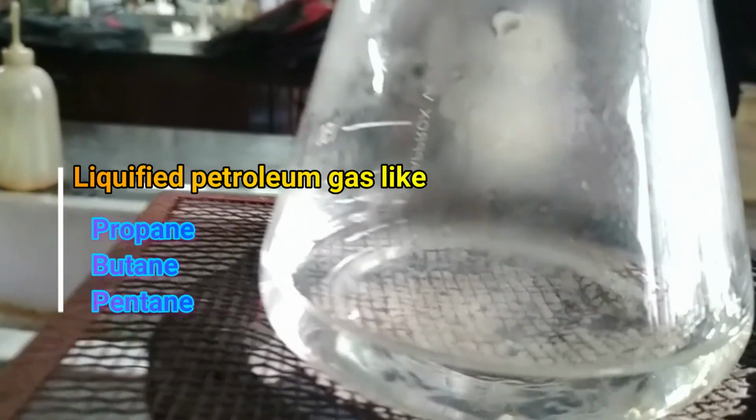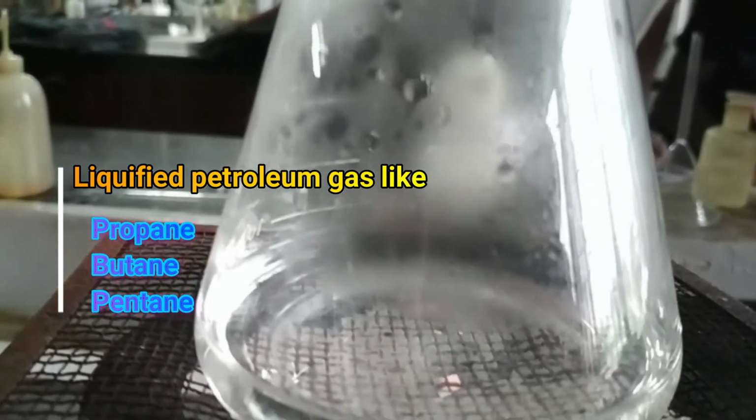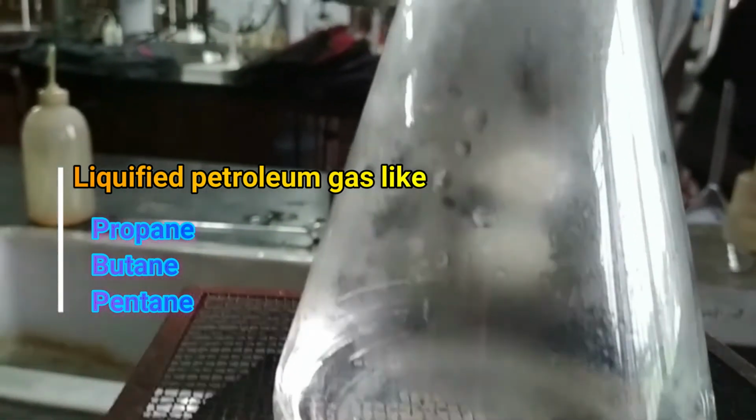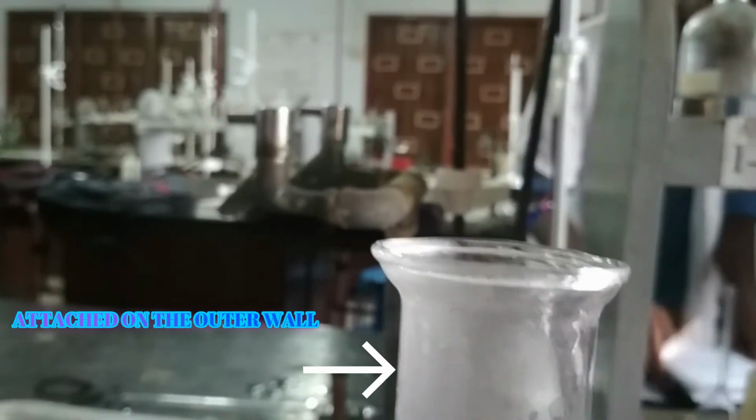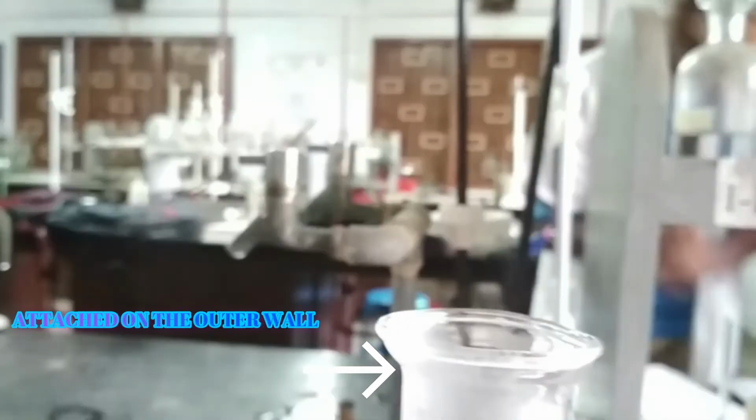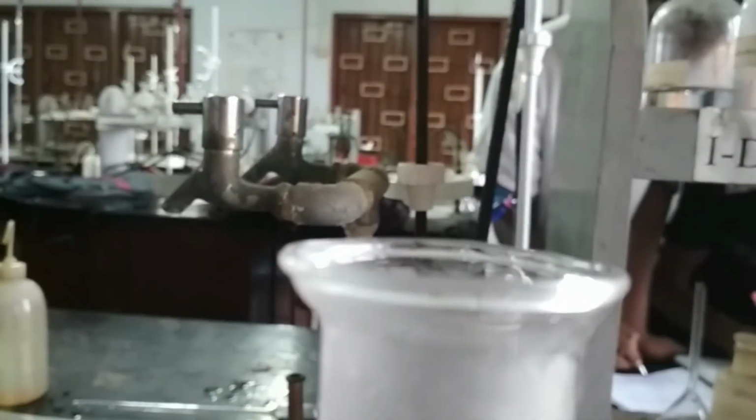When we burn these gases, they produce carbon dioxide and water, and this hot water gets vaporized and attached to the cold outer wall of the conical flask and gets condensed, producing a water vapor layer.